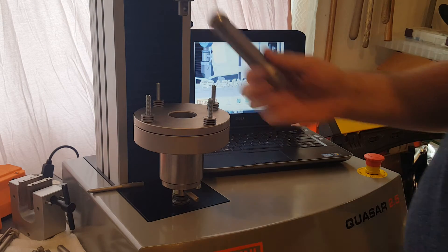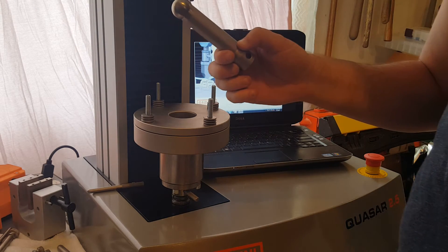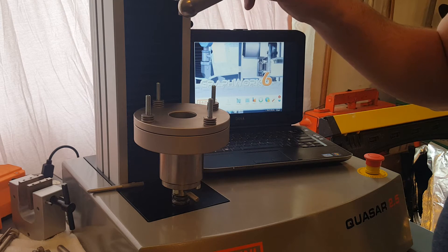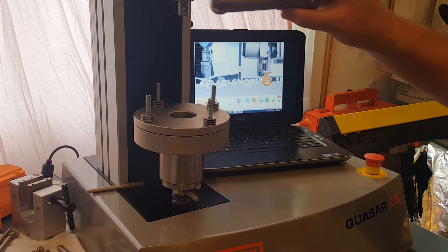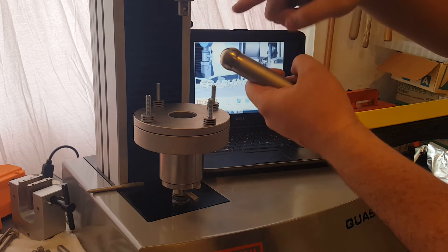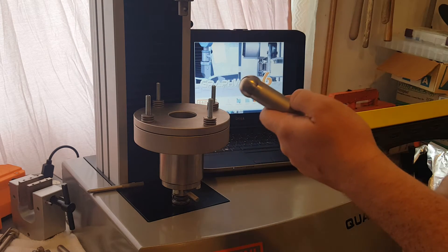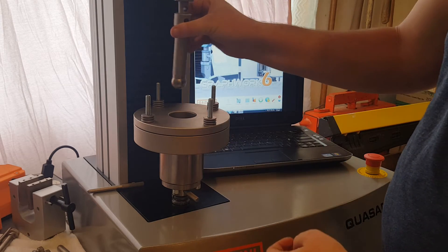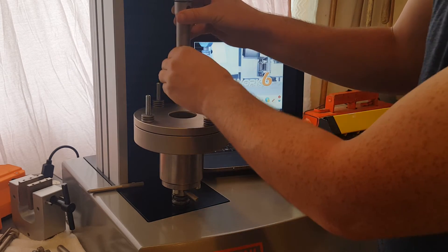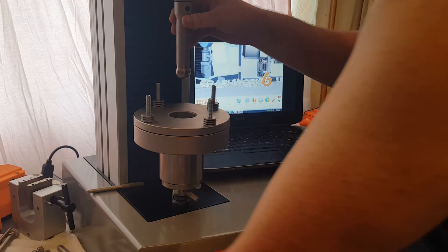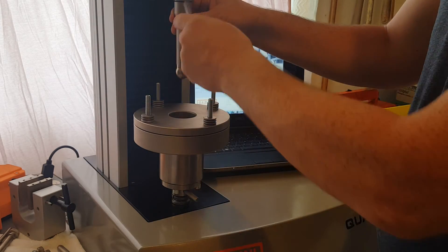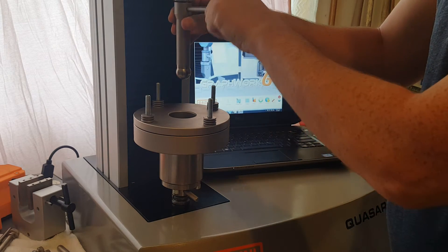Now the last part is the puncture plunger. So this is the 25.4 millimeter diameter plunger, also one inch on that measurement. That slides right up and we have our clevis pin.